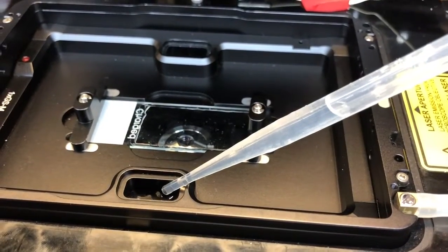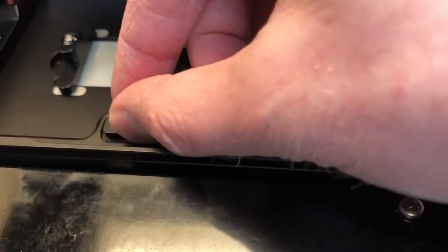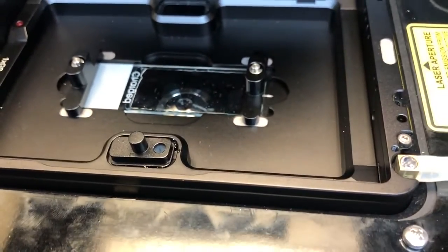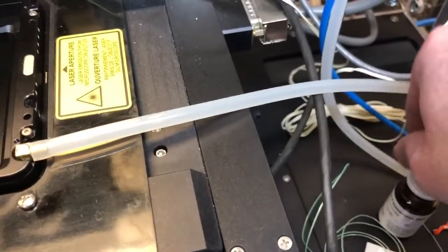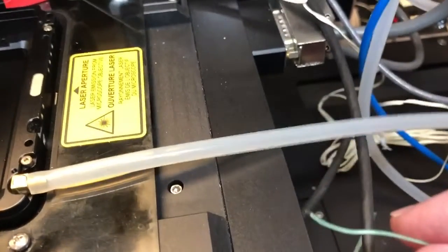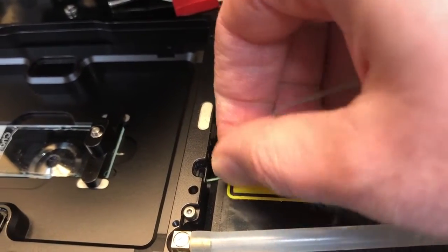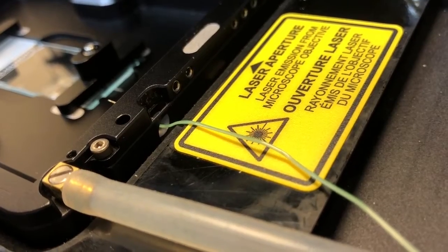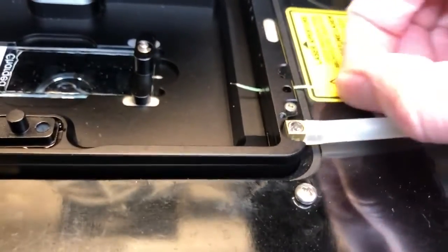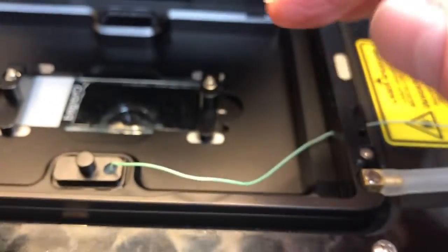Placing water here. I'm placing this special lid on top. That lid is in the same place where these magnetic attachments are. Finally, I'm going to grab the little wire thermometer and thread it in through the side of the holder. There is a little port where you can put in the wire — you can see it's a different color and material — and you can pull the wire in and put it in there. I think I might have overfilled it slightly.